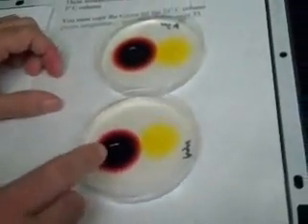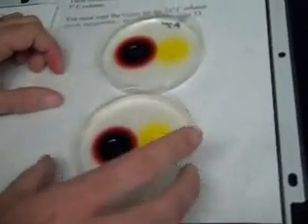The final experiment we did with diffusion illustrated the fact that substances at lower temperatures diffuse more slowly, because the molecular activity is less and the molecules move more slowly. We've got a plate of agar taken out of the fridge and one left out on the counter. You can see that the cold plate has slightly smaller stains than the warm plate, because at cold temperatures diffusion is less than at warm temperatures.